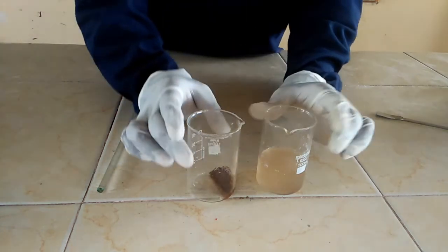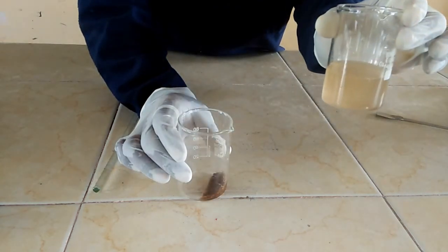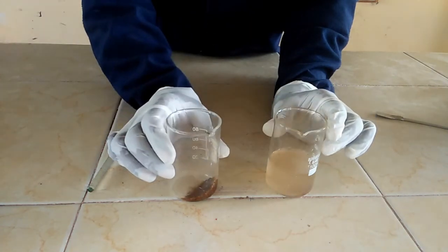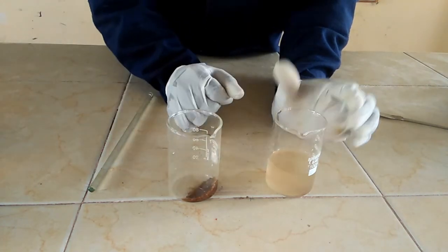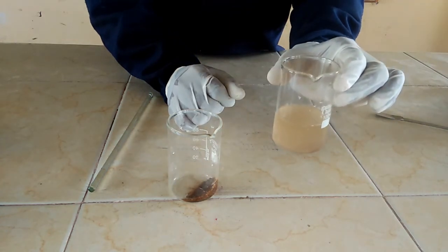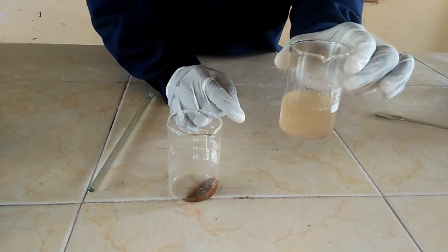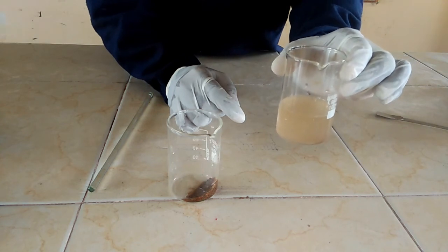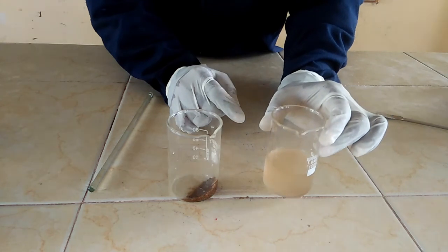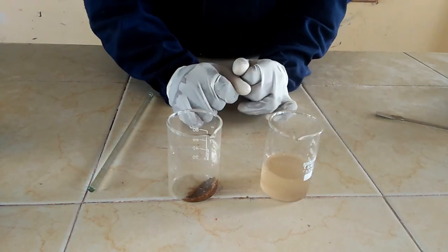We have separated our sand from water. In my beaker I have water and in this beaker I have the sand that has remained. The problem with this method is that our water is not very clean — the water still contains some solid particles which did not settle at the bottom of the beaker.